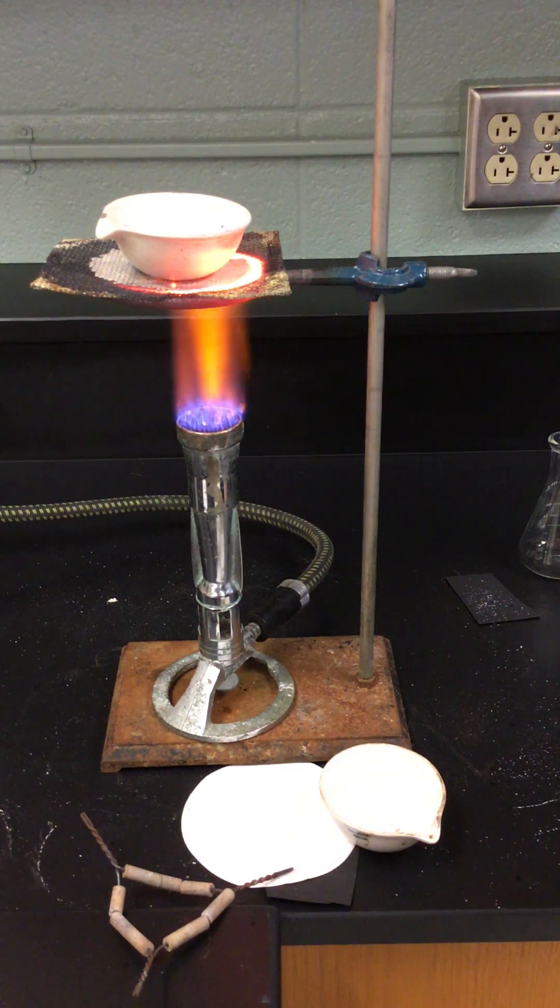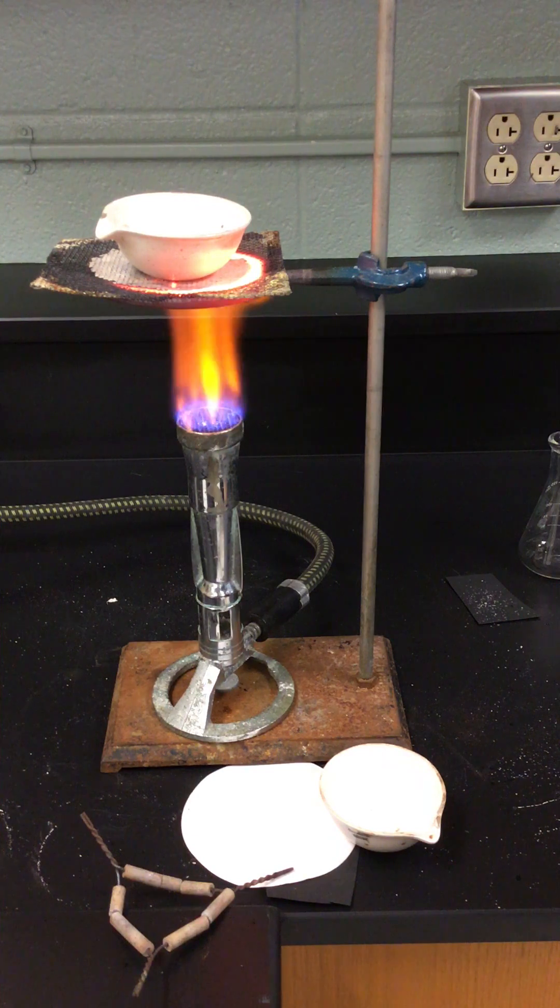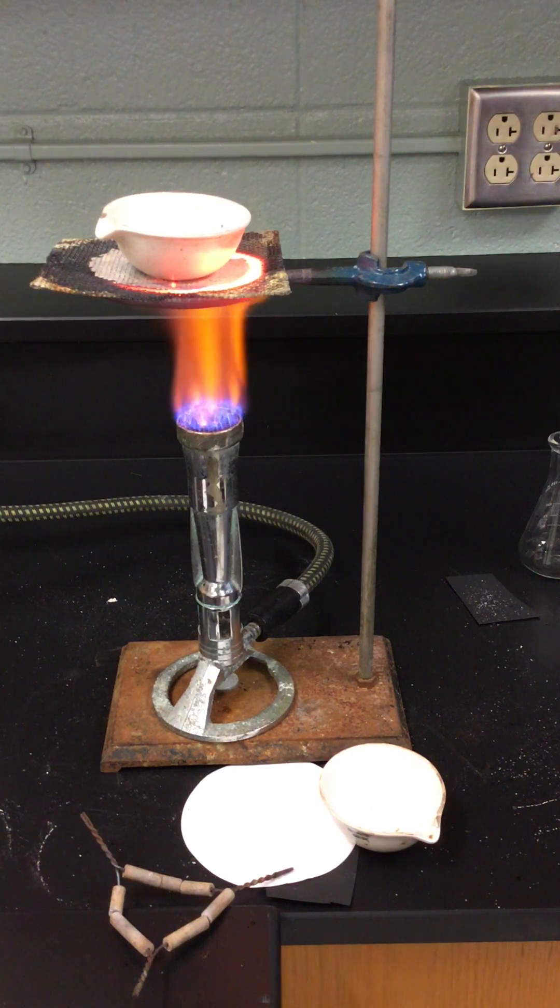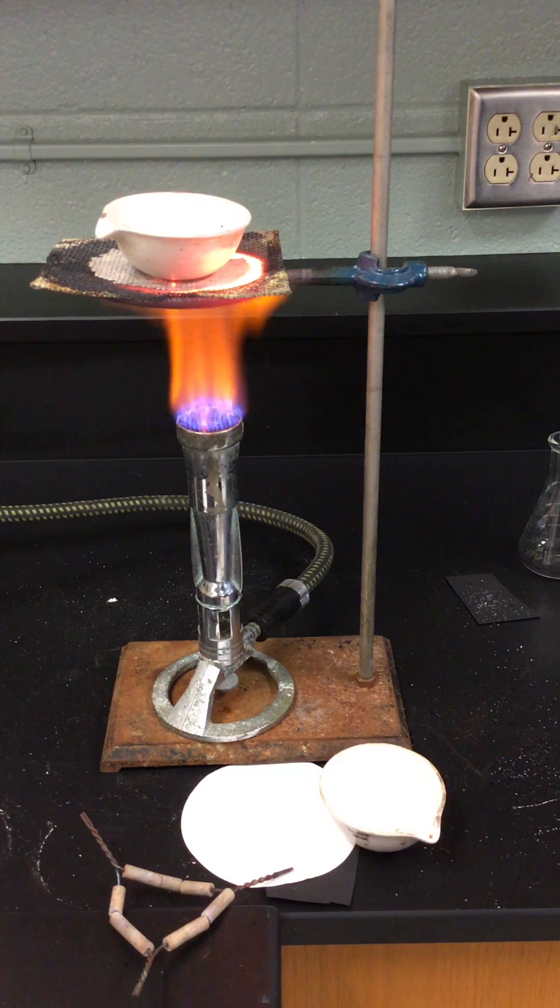So there's something in here besides water. We started out with a beaker containing water, sand, and table salt NaCl. We stirred it up and poured it through the filter. Oh I should be showing you what's on the filter. Good thing we remembered that.